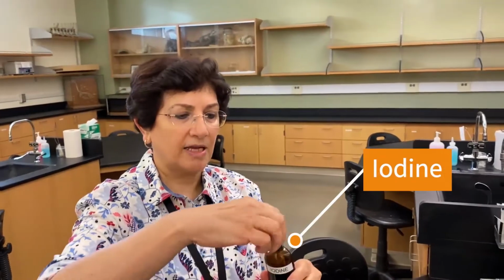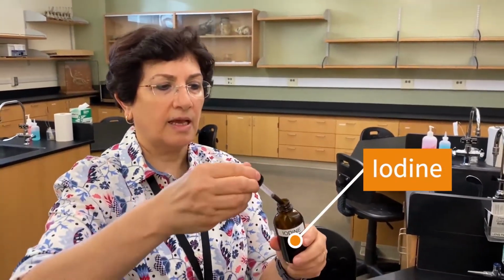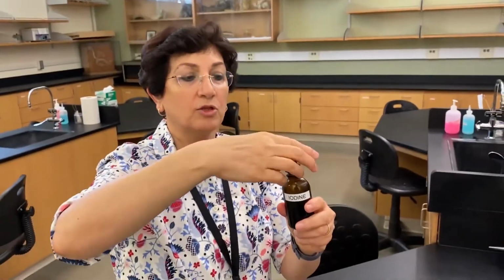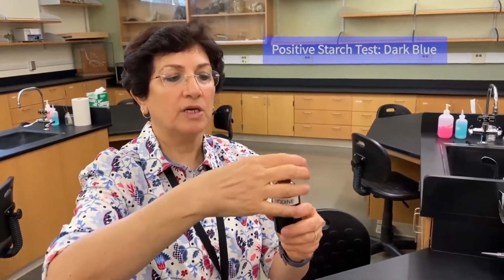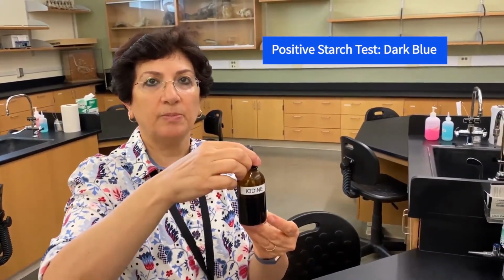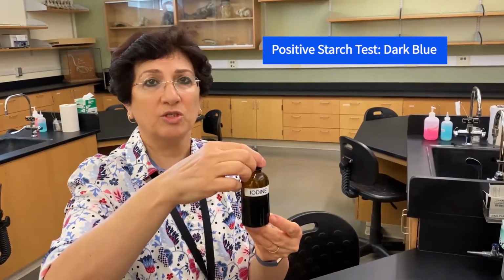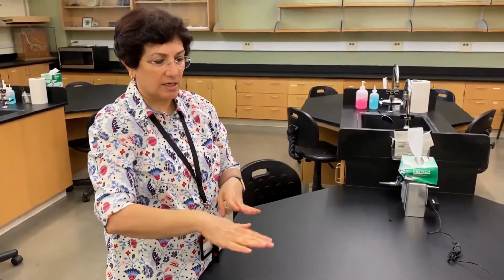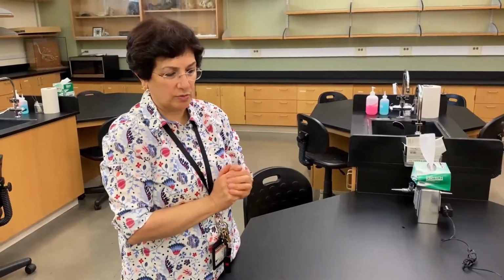We're going to use iodine, and I want you to see the color. It's like a brownish amber color. If I add iodine to a solution that contains starch, then we're going to see this amber color turn into a really deep blue color, almost dark jeans color. So dark blue color indicates the presence of starch in a solution. Anyway, these are the tests that we are going to use.